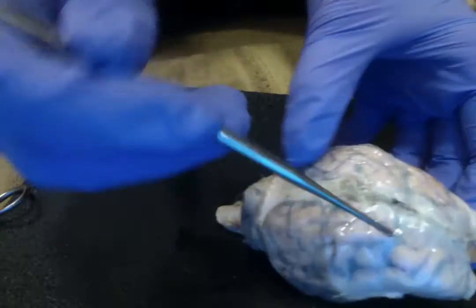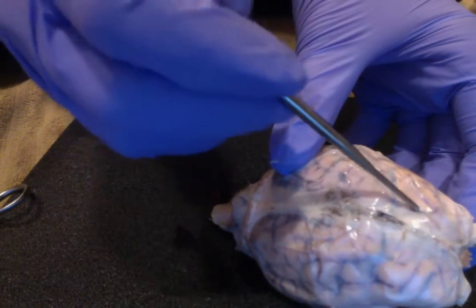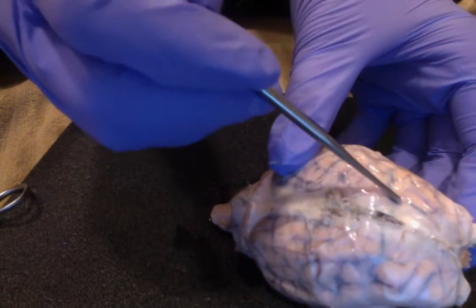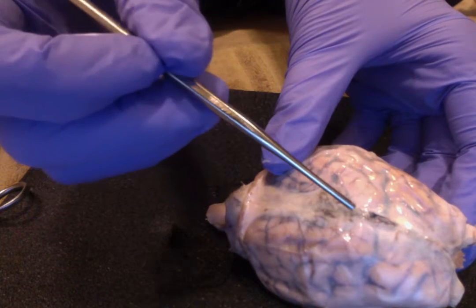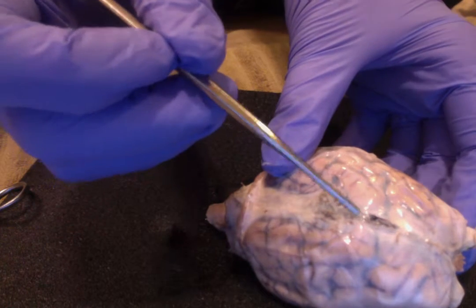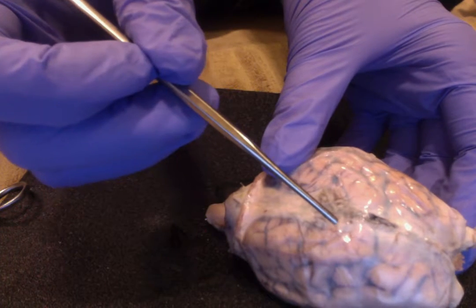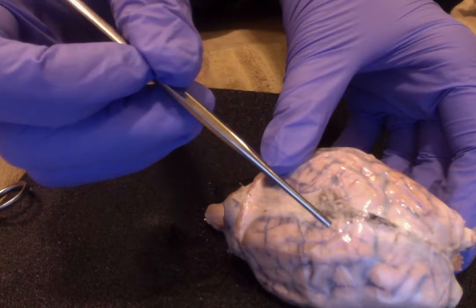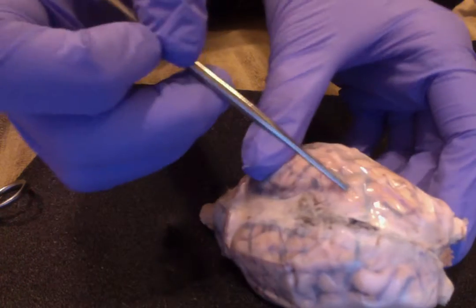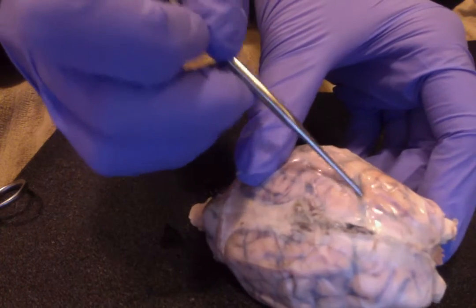Right here, these are going to be the sulcus grooves. This is what's called a gyrus — it's going to be the ridge right in here.